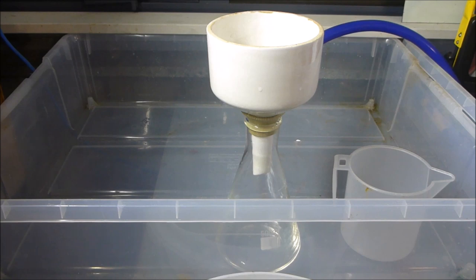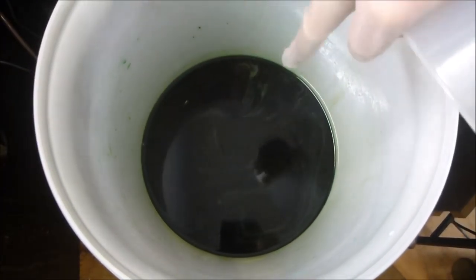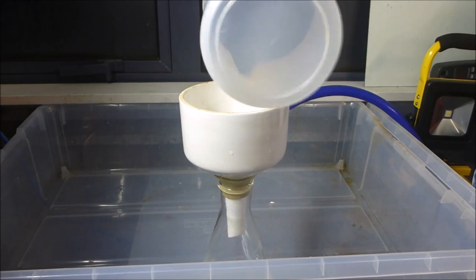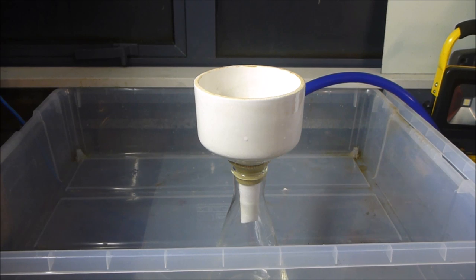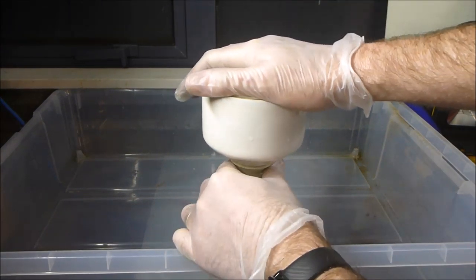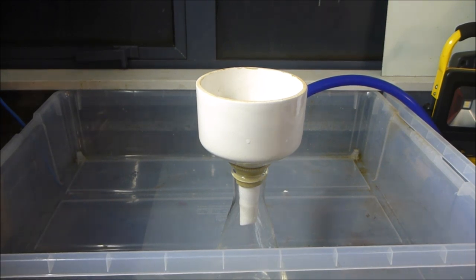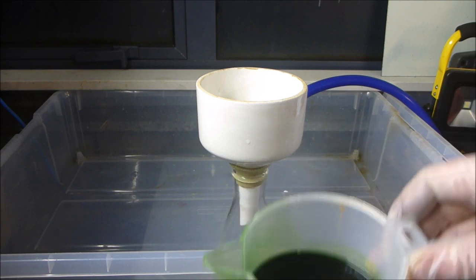So my preferred way of doing this is I've got the catch container right up against the bucket here. The bucket contains all the foils and the copper chloride solution, and I like to use a little container like this to grab some solution, pour it in there, and then hang it on the side of the bucket so there's no spillage. So we'll see if we can demonstrate this live. Not sure how well that's going to work. It's getting rid of all the drips.